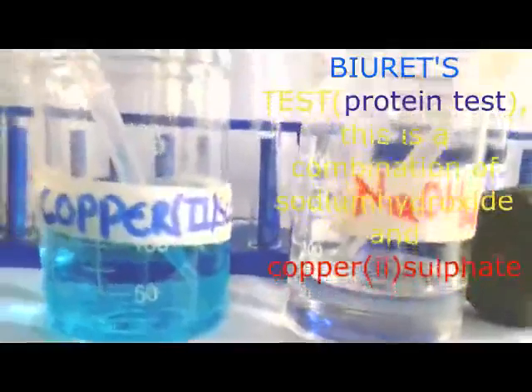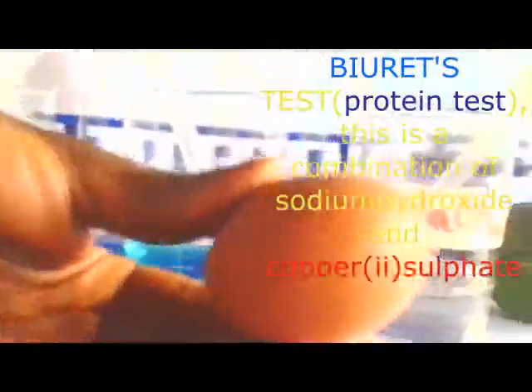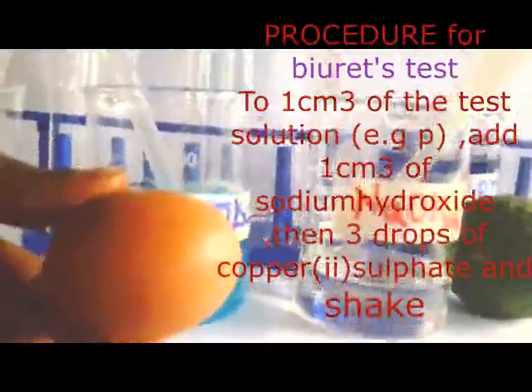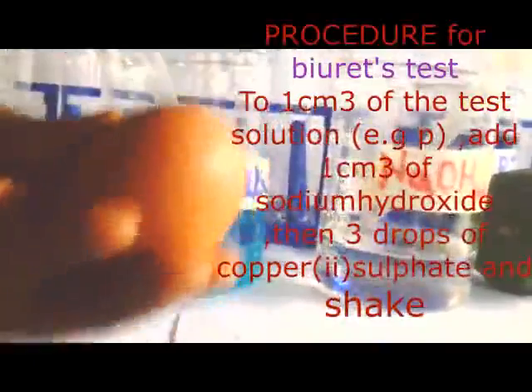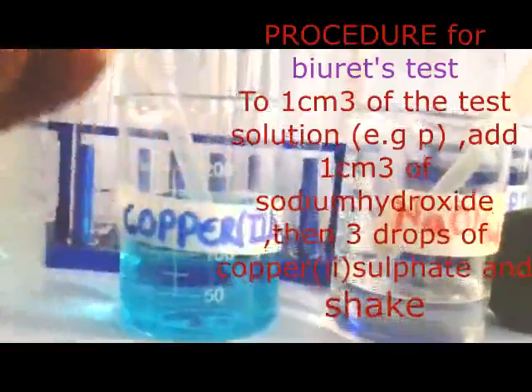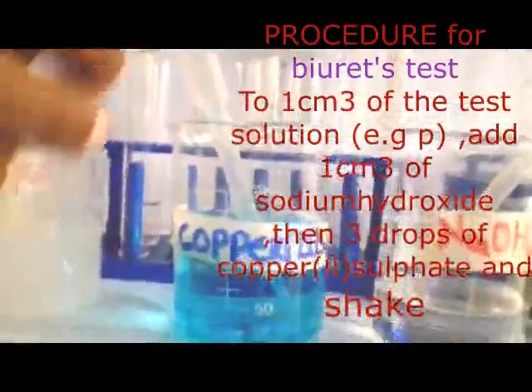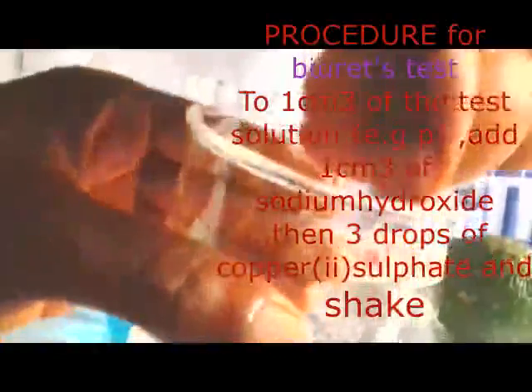Now, sources of proteins: you always enjoy meat, you always enjoy fish, you always enjoy egg. You can look at our egg there. That one is going to act as our source of proteins. Now I'm just going to break it, then I get a solution from our egg. Then from there, we shall see what happens next.